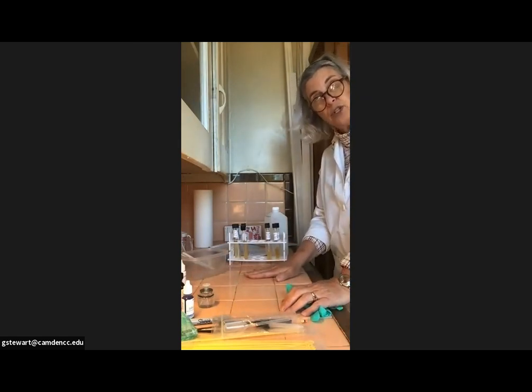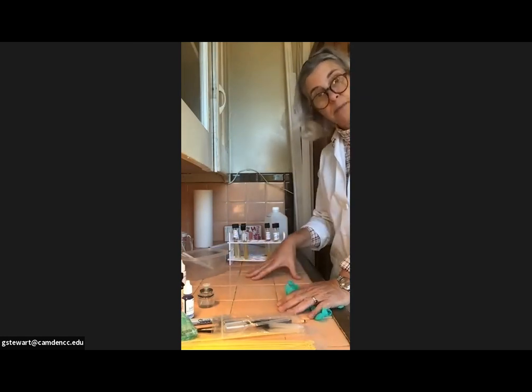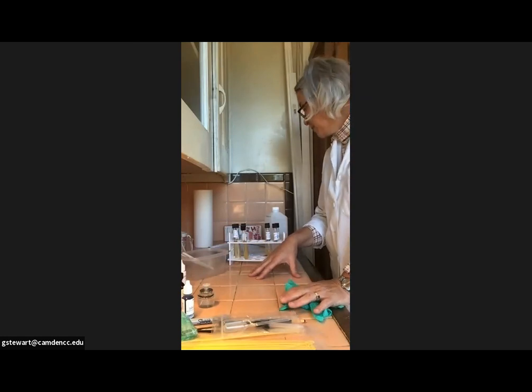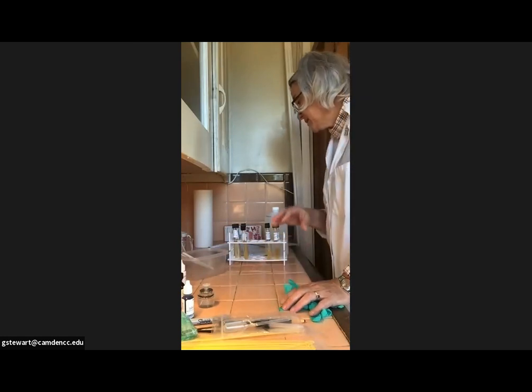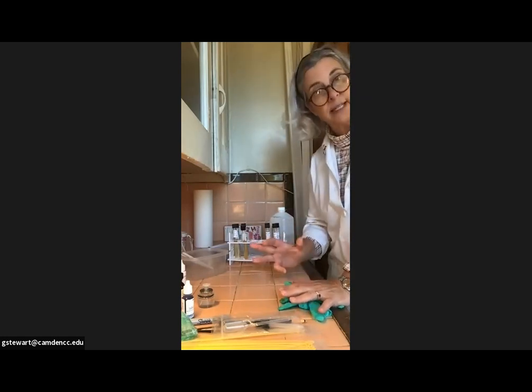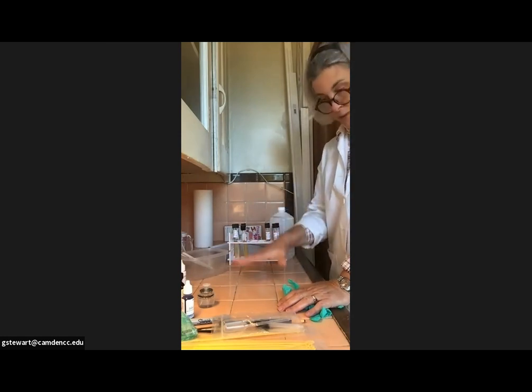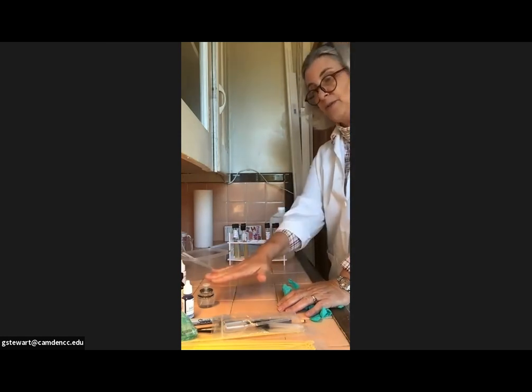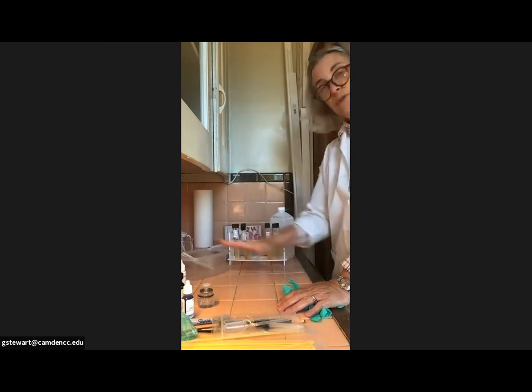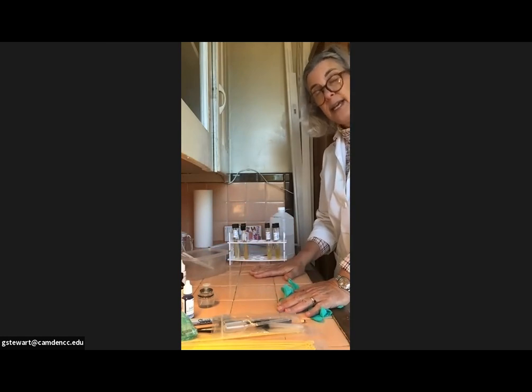I'm going to show you doing the simple stain and then also the gram stain, but I am going to make all my smears at the same time for both of those activities. They would be activity 1 in the simple stain, it's activities 1 and 2, and activity 3 is actually the gram stain or the differential stain. So we're going to make the smears, dry the smears, fix them, and then I'm going to go through the staining procedure with you for both a simple stain and a gram stain.